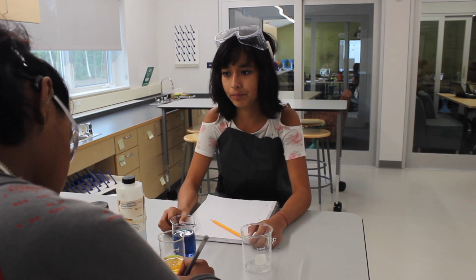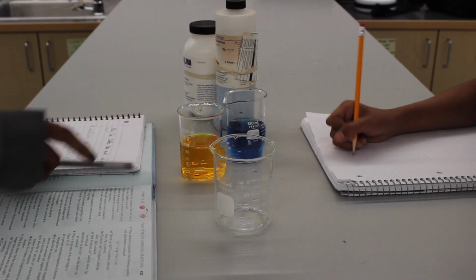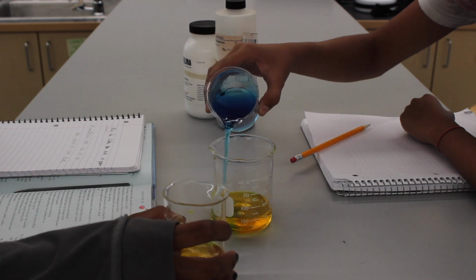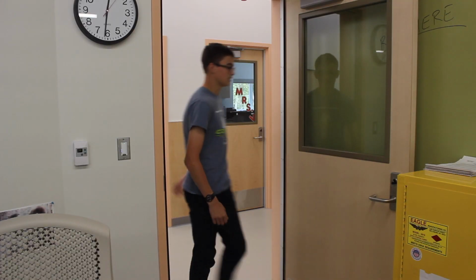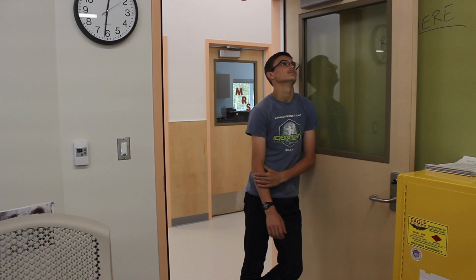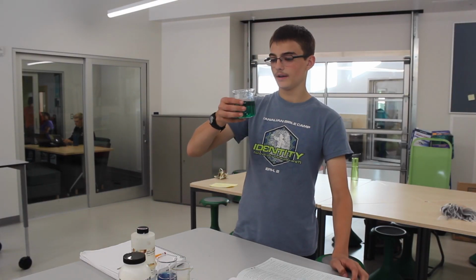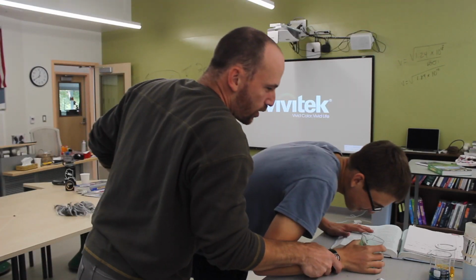Okay, so what's next? Okay, now we mix the sulfur dioxide with the bromothymol blue. Oh, forgot the iodine. Mr. Hummel brought Kool-Aid. Green Kool-Aid. It's my favorite. No! What are you doing, Trevor? That's acid. Acid?